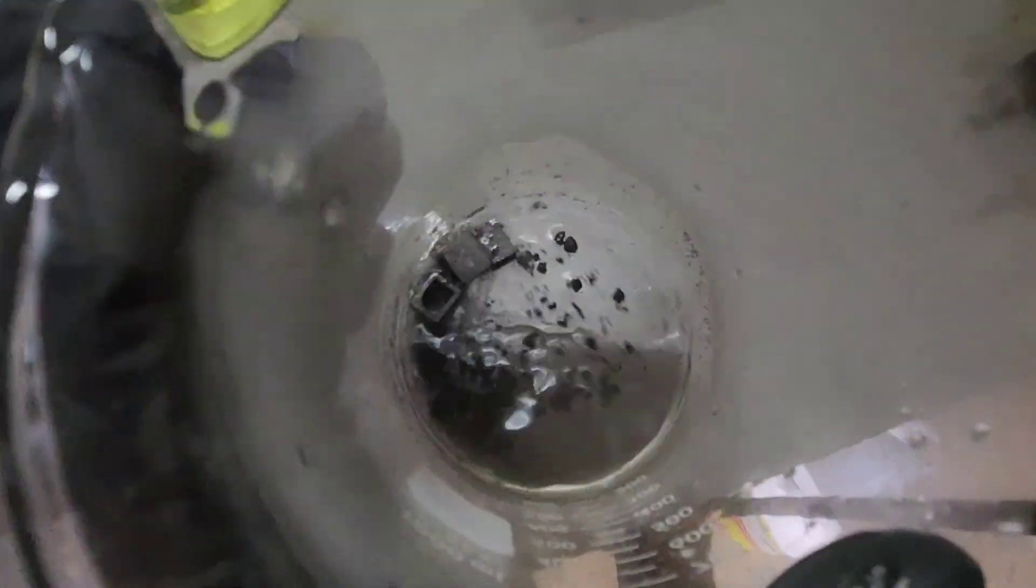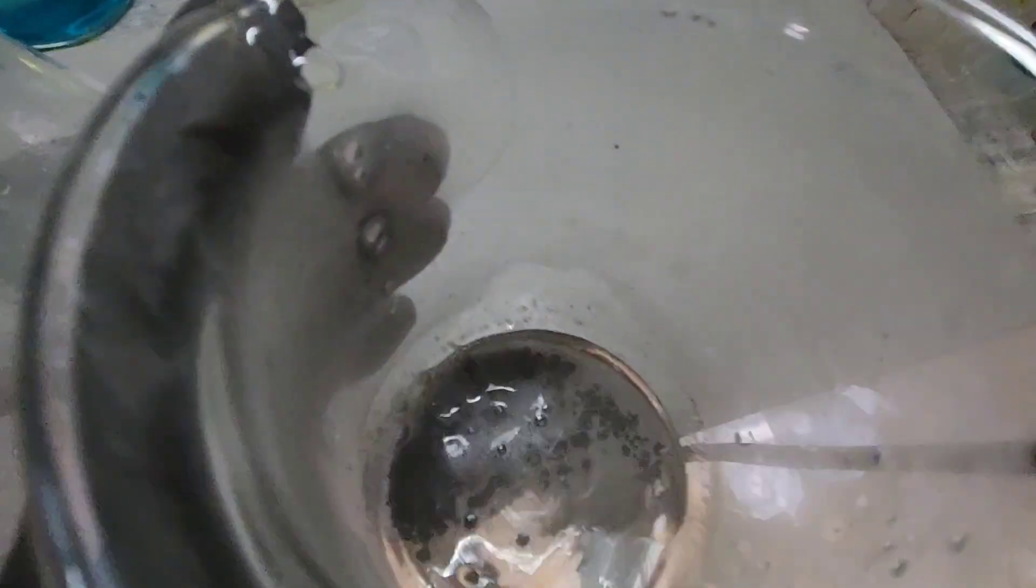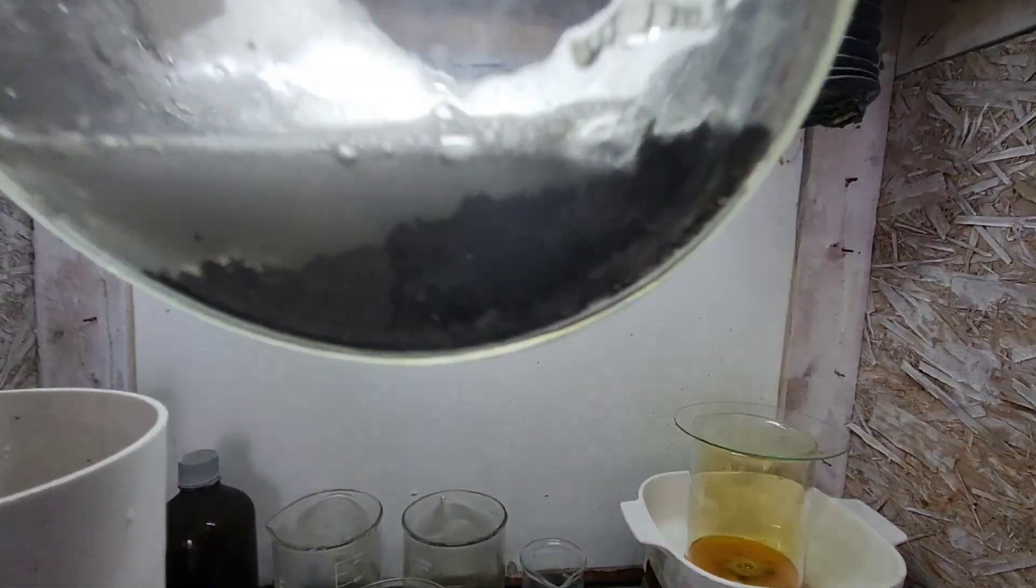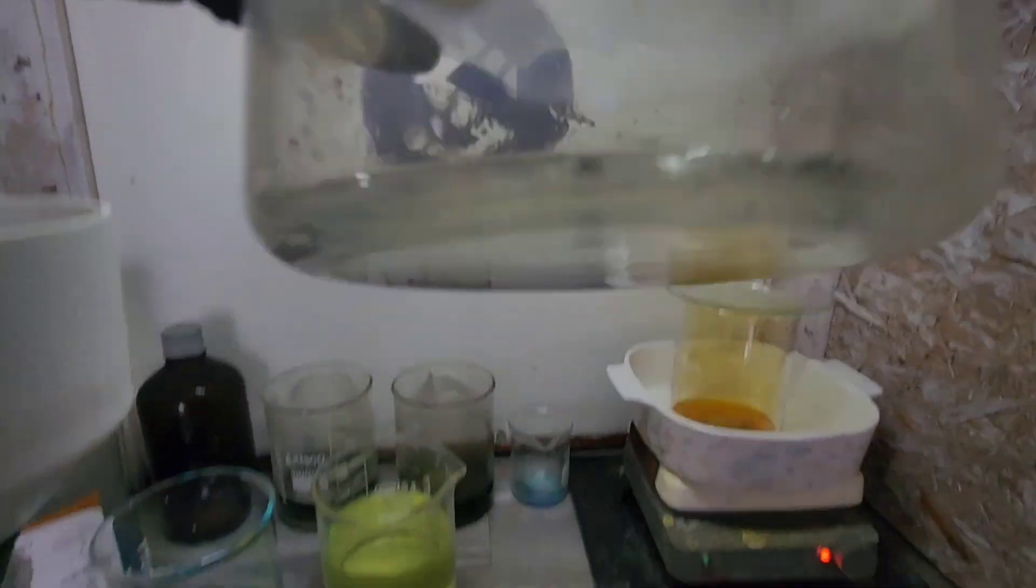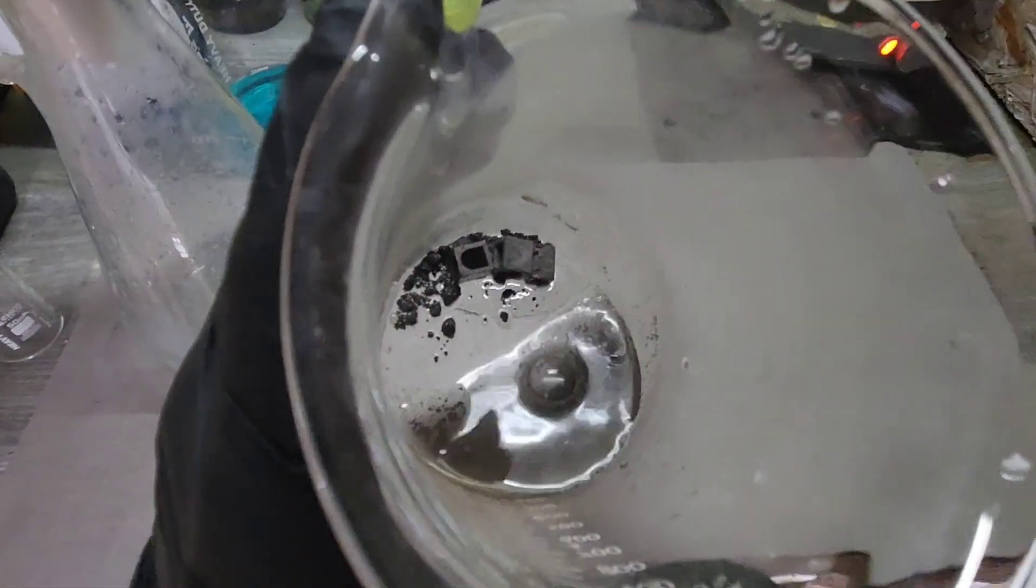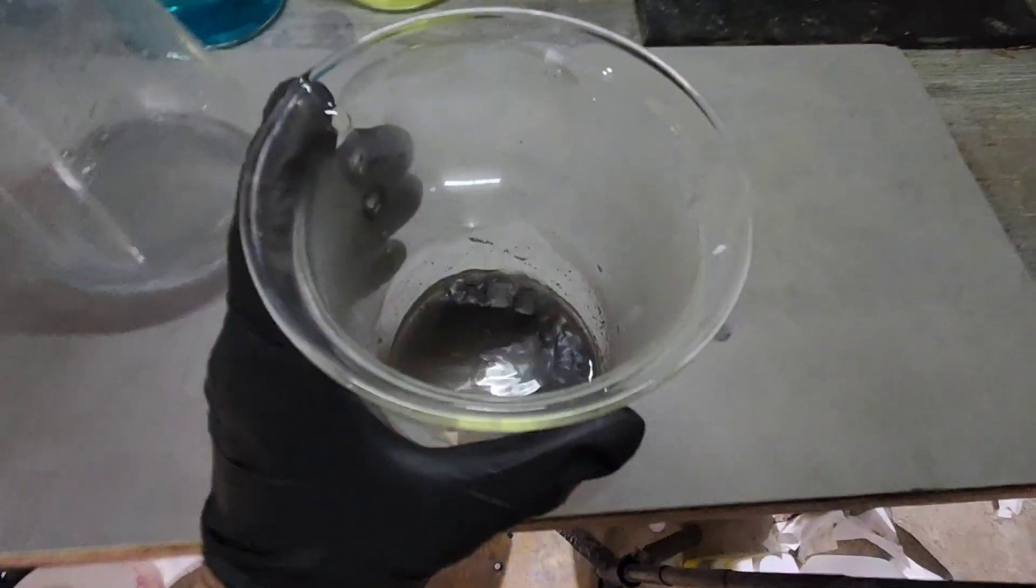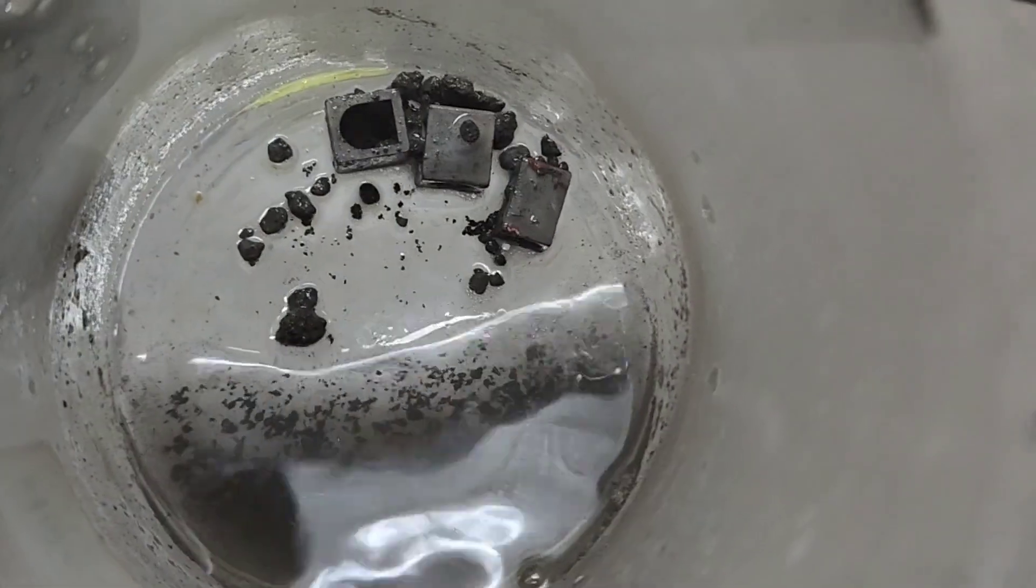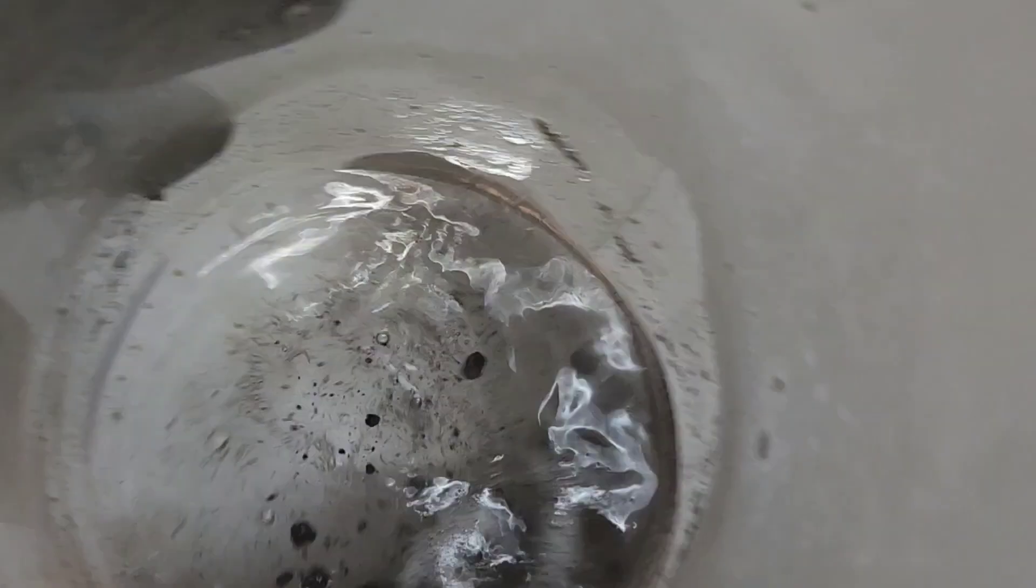This is still working away here. We can see it's starting to clump together and there's hardly any white left. We can still see a little bit, but a lot of what you're seeing there is bubbles from the actual reaction itself.